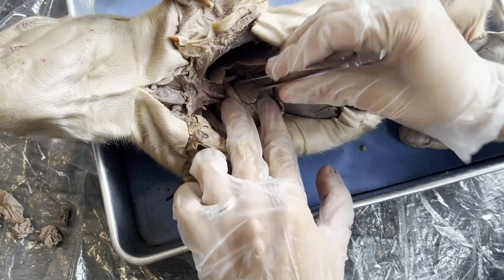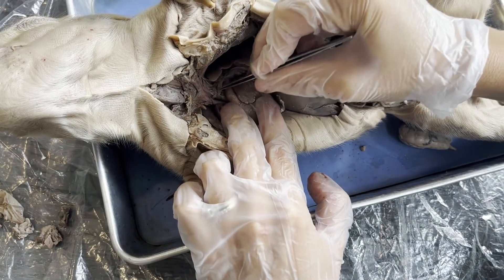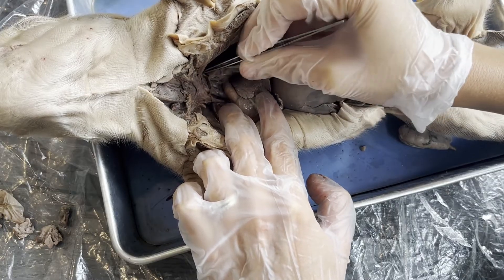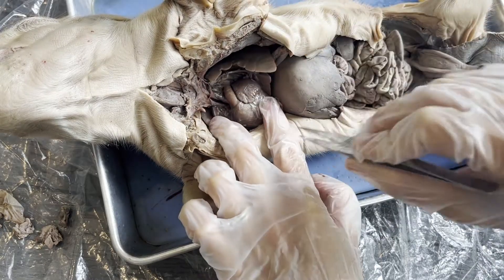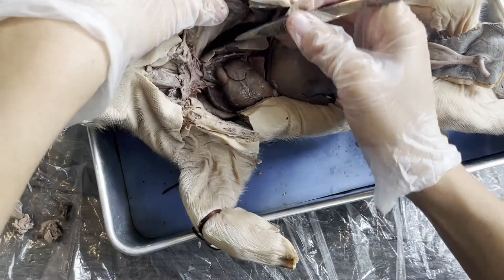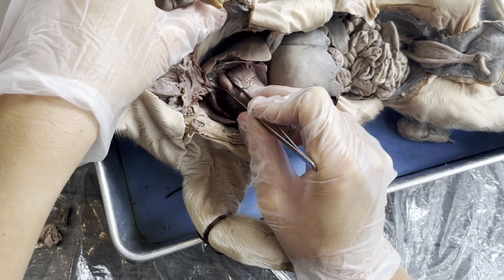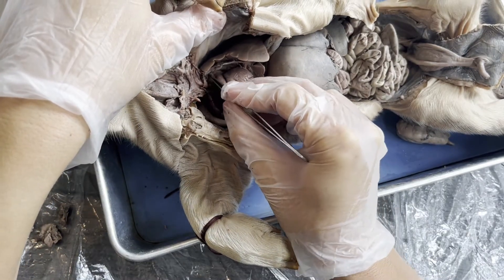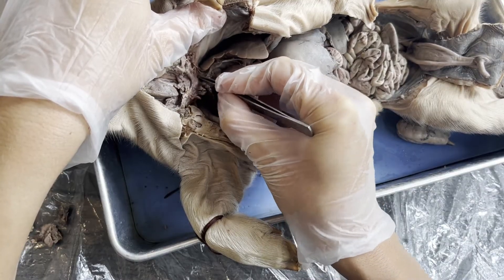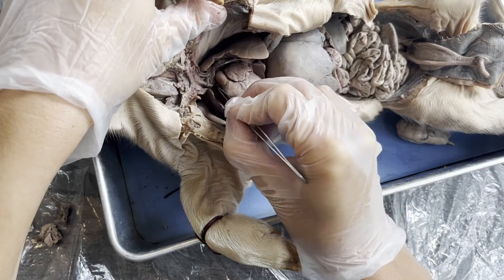Our pig's aorta is a little bit messy, to be honest. You can see the branching aorta — all of this space here where it's a little bit darker. This is the aorta of the fetal pig I'm dissecting. So we have the pulmonary artery, and then right behind it, branching into other blood vessels, we can see some of the other blood vessels. Let's isolate those, because we have the aorta.